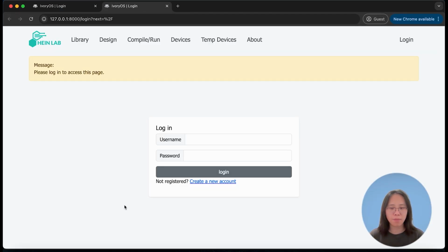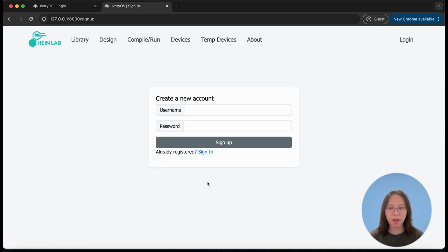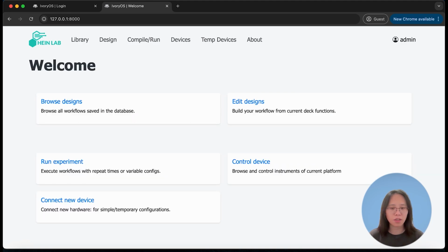It will show you the login page, but if this is the first time you're using this app, then you can create a new account. This will be an account created in the local database. I already have my account created as admin, so I'll just log in to my account. So once you log in, you will see the welcome page.